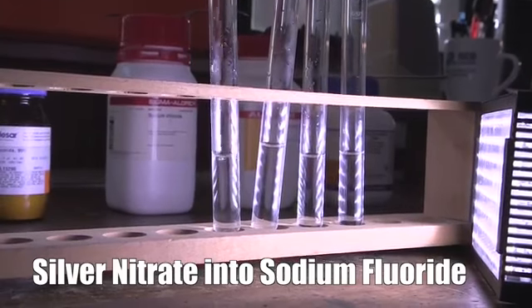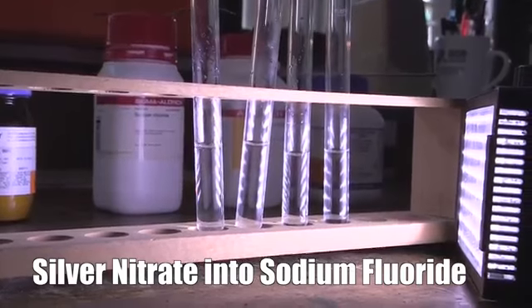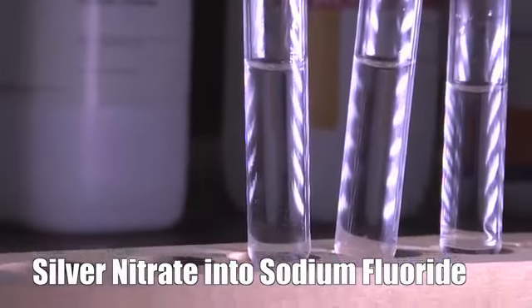So as a test, although I didn't mention this to Sam, she decided she would use fluoride as well. That's all 4 halogens that you can get easily. Astatine and the new one, tennessine, aren't really available to do lab experiments. Silver ions with fluoride was a bit disappointing. Silver fluoride is reasonably soluble in water, so you don't form a precipitate.